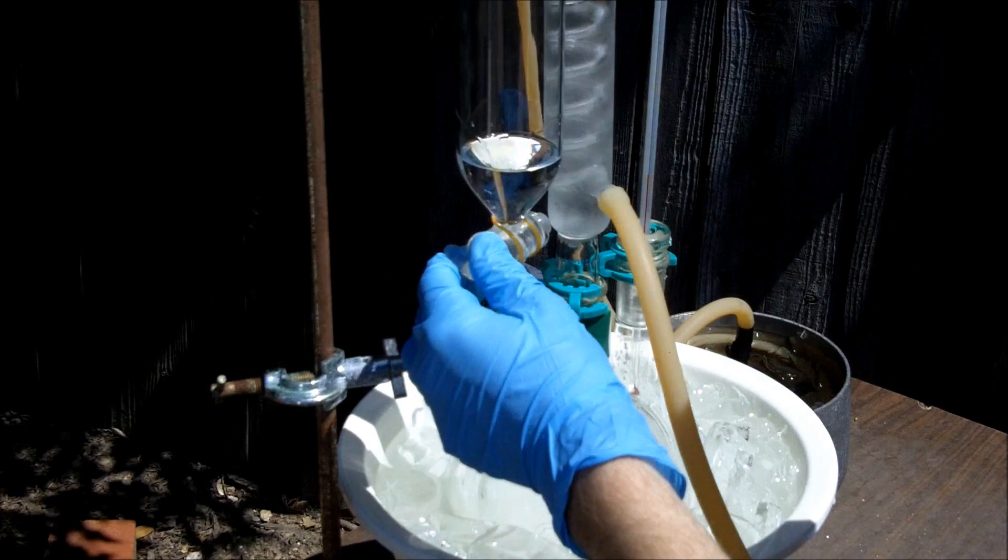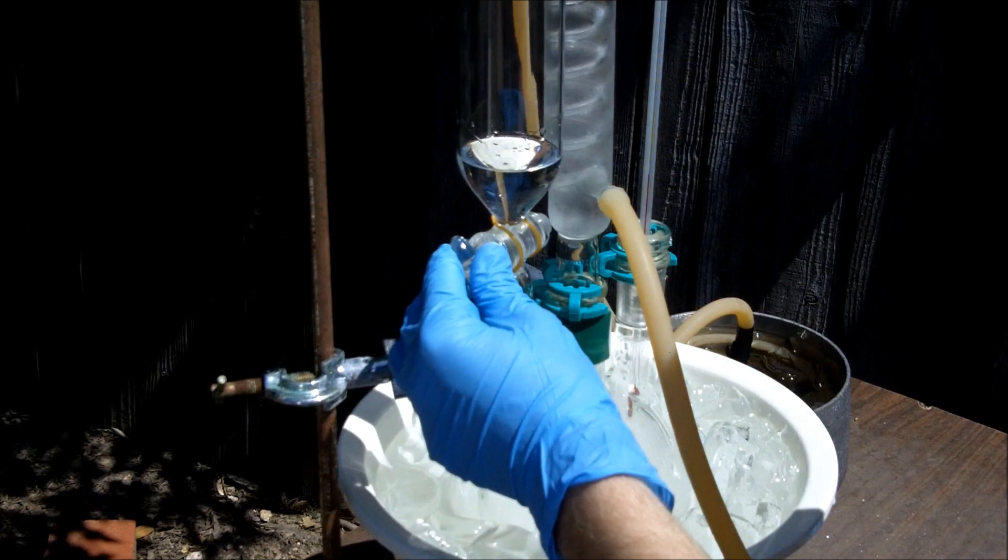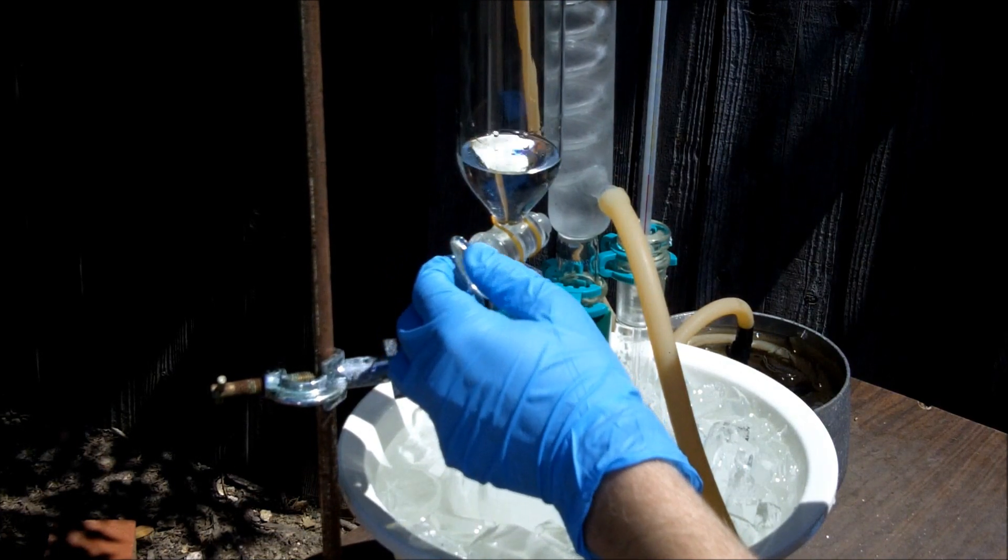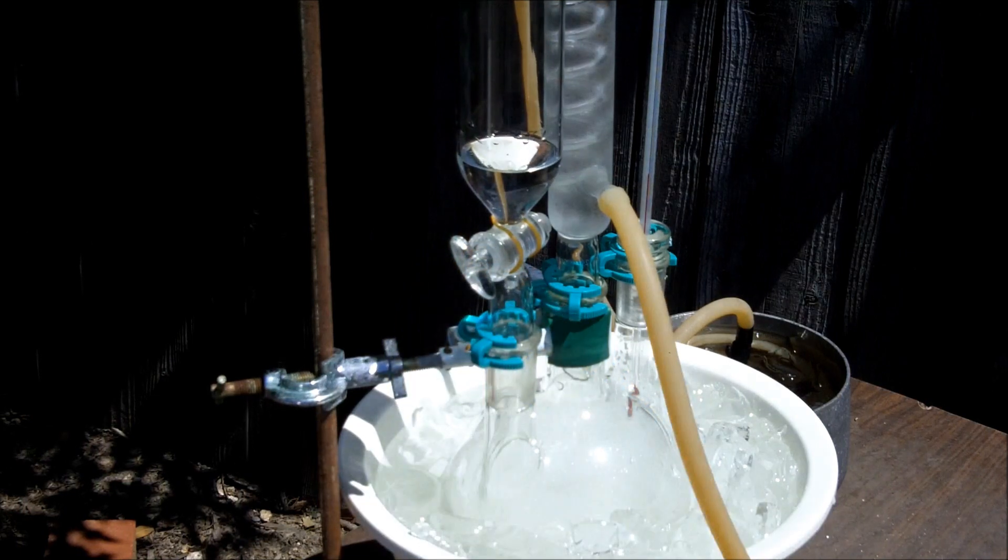Okay, I'll start adding acetone very slowly, and I'll show you guys how this reaction looks in a few minutes.